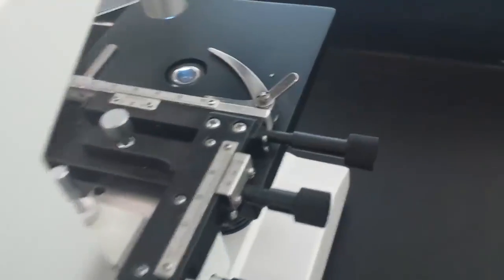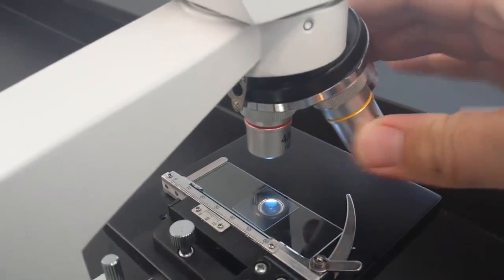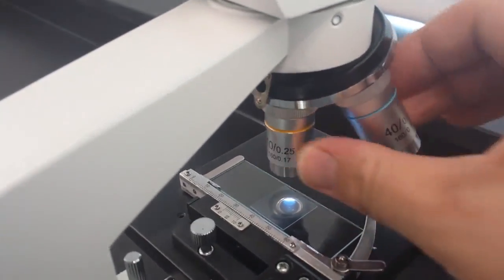Take the slide and put it on your microscope. I'm going to use my other hand for this. Stick the slide into place, and then you're going to want to use your high power objective. So I'm at low, medium, high.